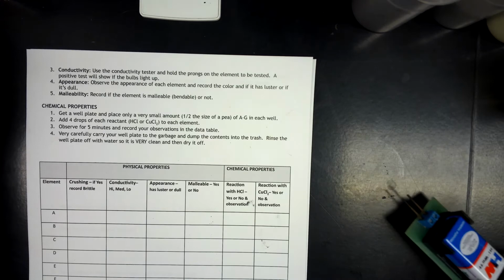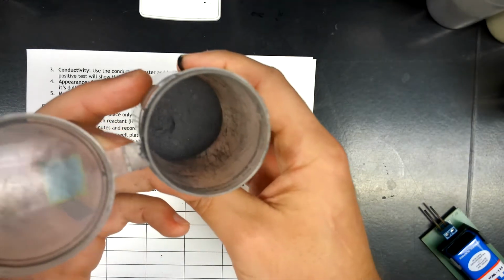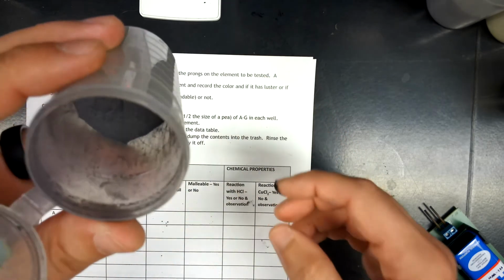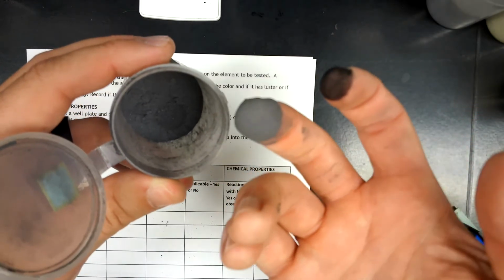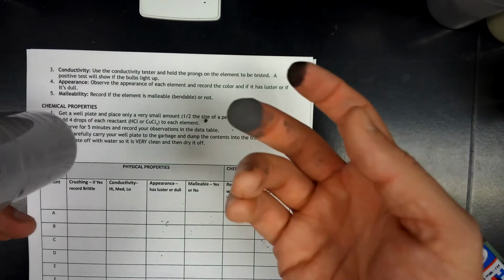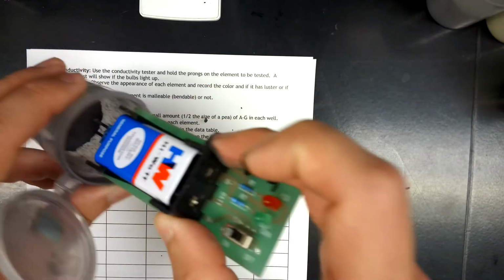A, B, C. Keep moving so I can get all of these in here. This one is a gray powder with maybe some shiny, I don't know if you can see it on the camera very well, but there are shiny flecks in there. So maybe an interesting one. Fingertip test, put my fingertip in there, comes out absolutely coated. Maybe you can see that a little bit better now with the glitter on there even. So that's appearance, means it's crushable, but not malleable, and not conductive at all.